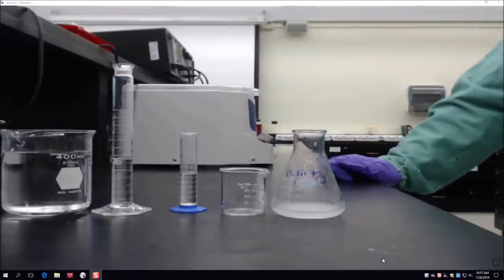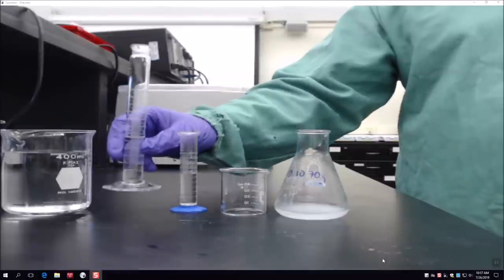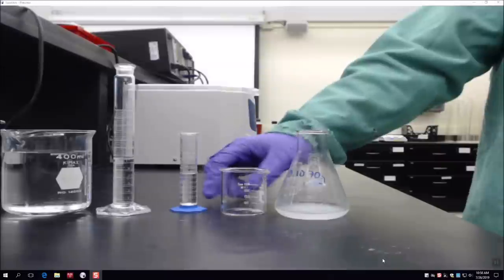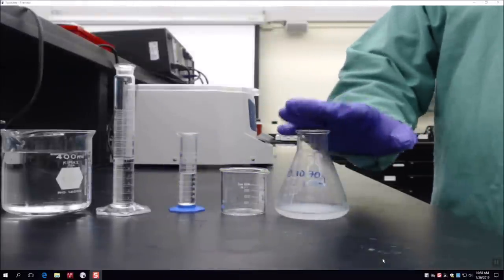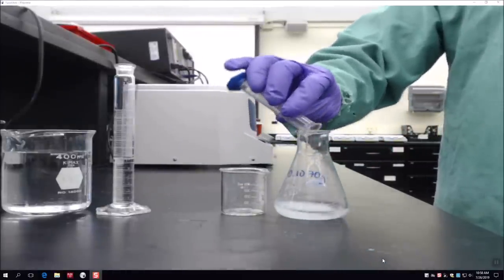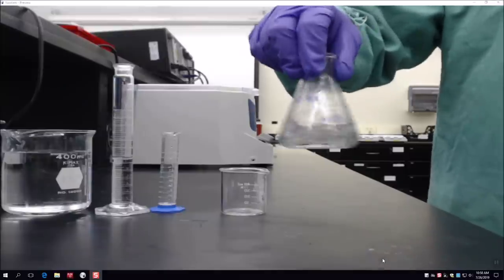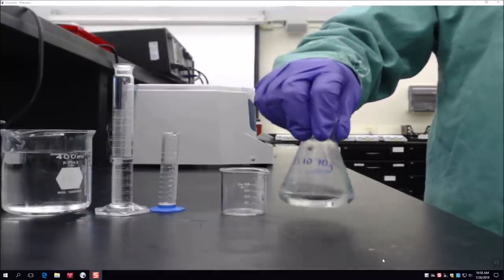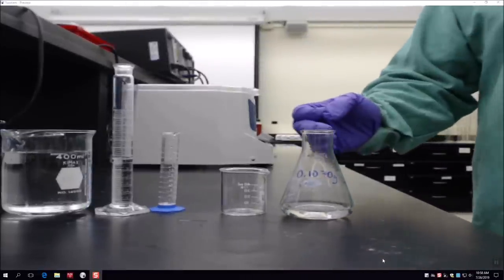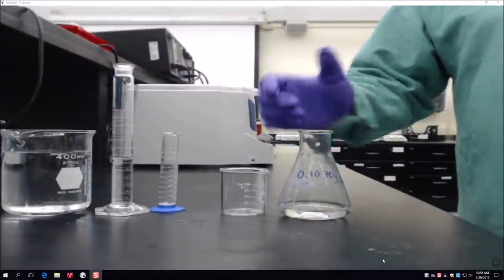I'm going to show you the reaction of our magnesium hydroxide solution with sulfuric acid. I measured 18 mL of diluted sulfuric acid in a 25 mL graduated cylinder and placed 6 mL into a smaller one for our reaction flask. Taking the 6 mL of sulfuric acid and pouring it into the flask — you should see on the camera that the solid within the solution appears to disappear. As Colin said, we're going from insoluble magnesium hydroxide to soluble magnesium sulfate, so we expect no precipitate — and there is not.